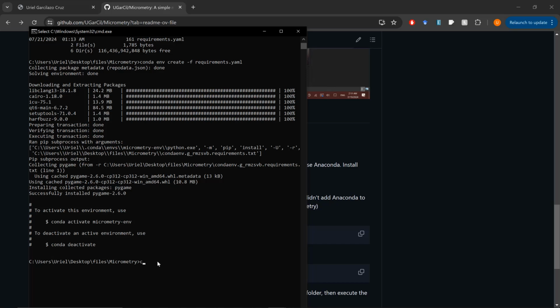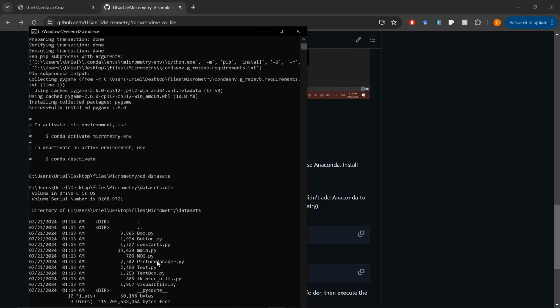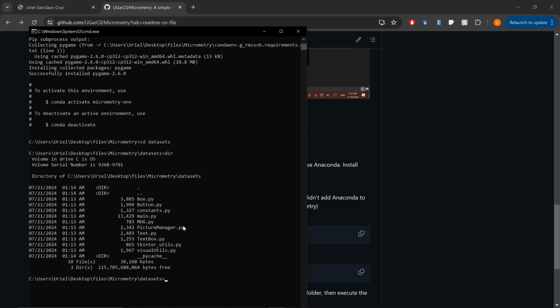First, I'm going to change directory and enter datasets. Remember, we are in the main folder of Micrometry. Once we are in here, the files that we can see include, among other things, the script called main.py. This is the most important script you're going to use. First of all, we need to activate the environment that we just created. So we're going to type conda activate, and then micrometry-env.